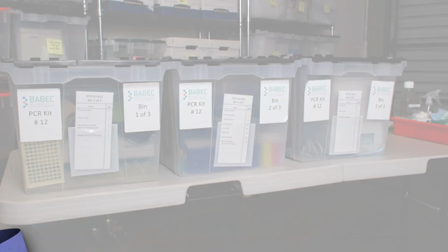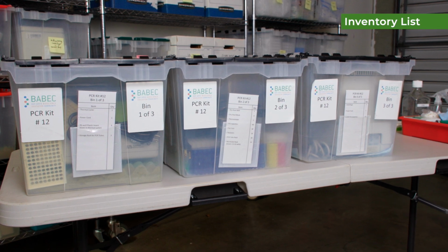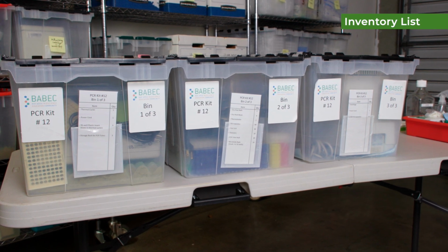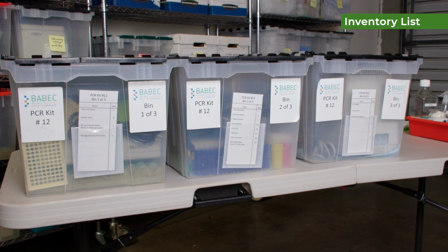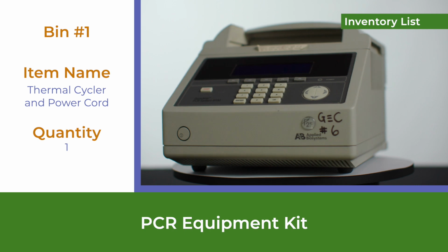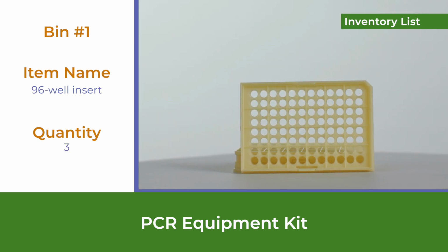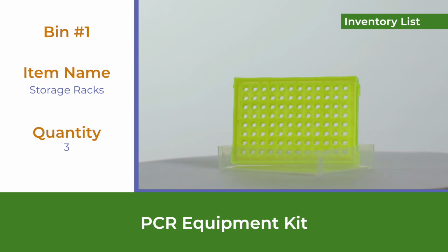There should be 2 or 3 large plastic bins depending on which kit you get, with these inventory checklist cards attached to the front. Use the checklist to verify all items are present. In bin 1, you will find 1 thermocycler and power cord, 3 96 well inserts, 3 storage racks.